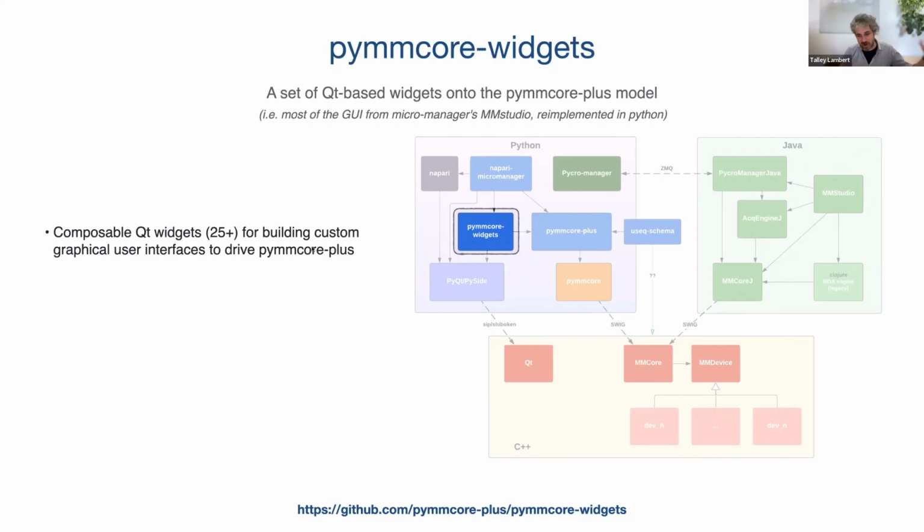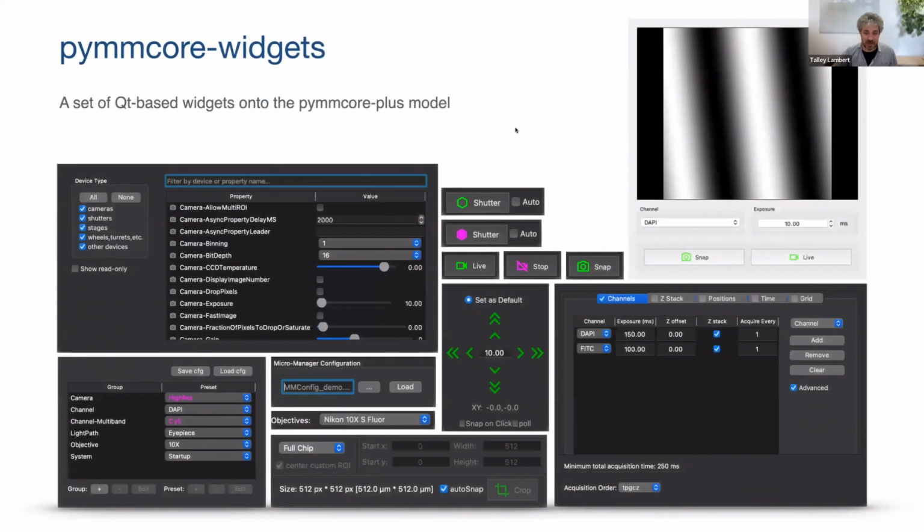If you didn't need the full Napari Micromanager, which we'll talk about in a second, this would give you a set of widgets, like, for instance, just a snap button that whenever you hit snap will call core snap image, or live, which will call core start continuous sequence. There is a device property browser. There is a multi-dimensional acquisition setup, camera ROI, config preset. So all the stuff you're used to in the MM Studio GUI.